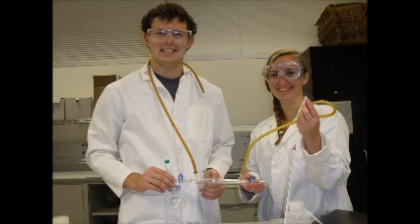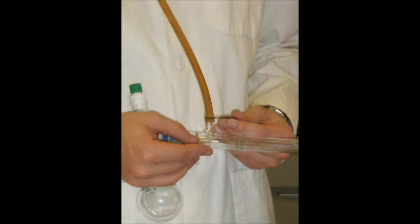Finally, we attach the rubber tubing to the nozzles on the condenser. Make sure that they are long enough to reach a faucet and a sink respectively, and that they are held tightly with clamps.